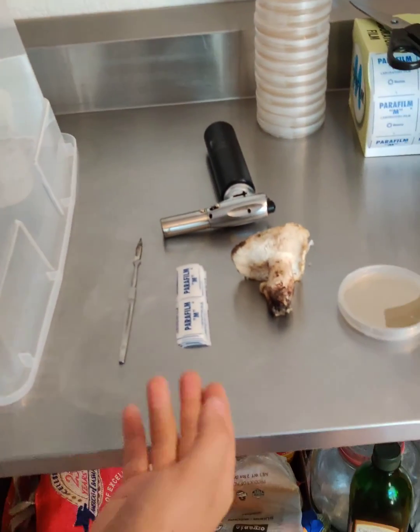Hi everyone, I'm Chris and today we're going to be tissue culturing some native mushrooms. Everything you need to tissue culture a mushroom is shown here.